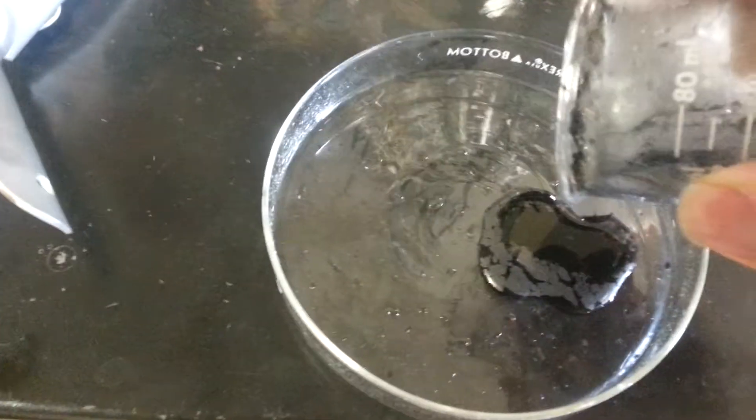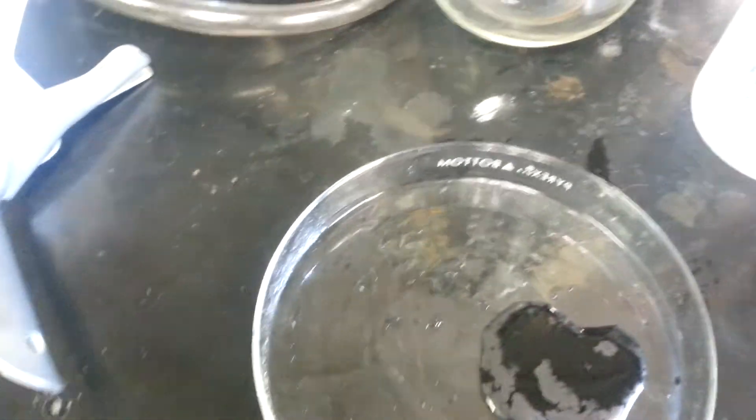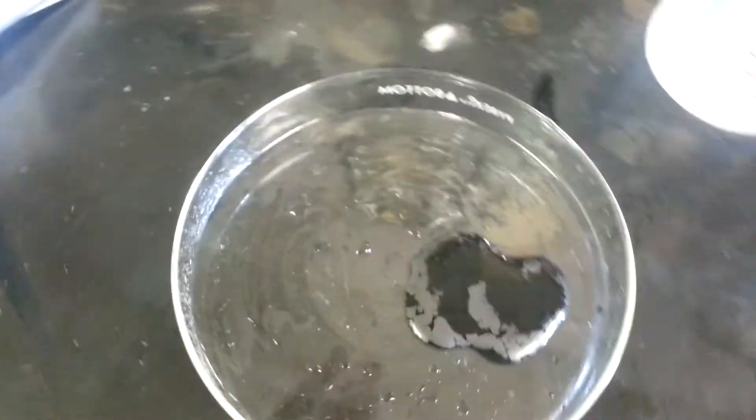You pour it out and you can see the stuff's on the top. It is what it is. Watch this.